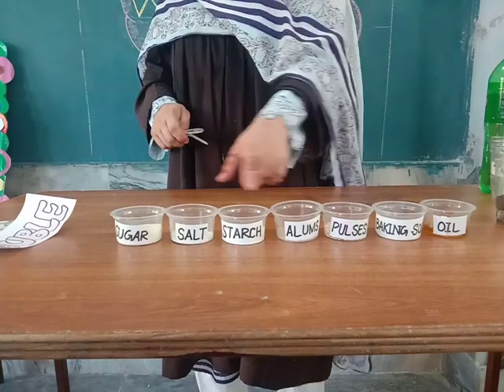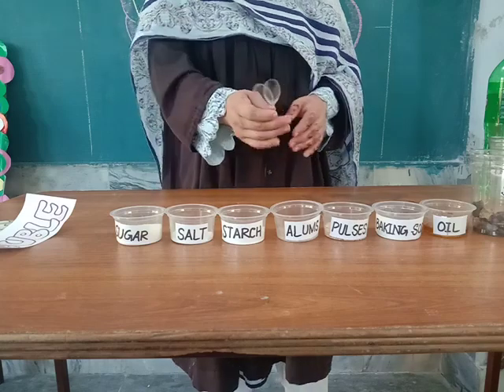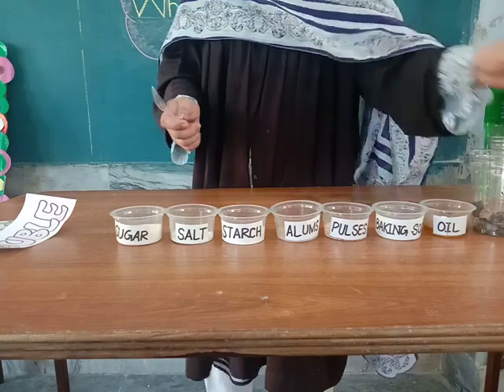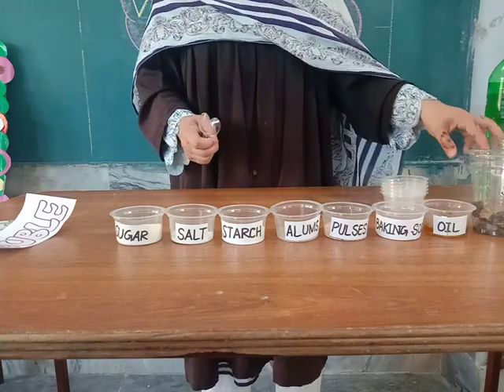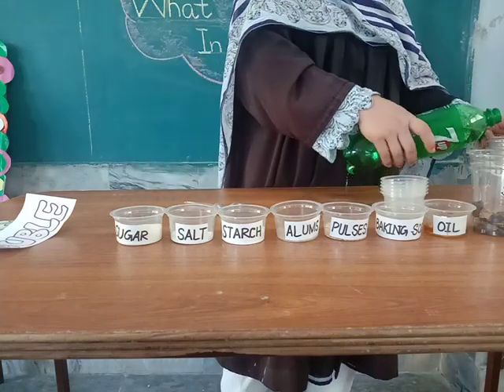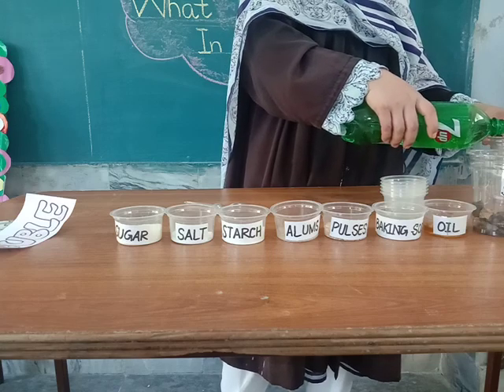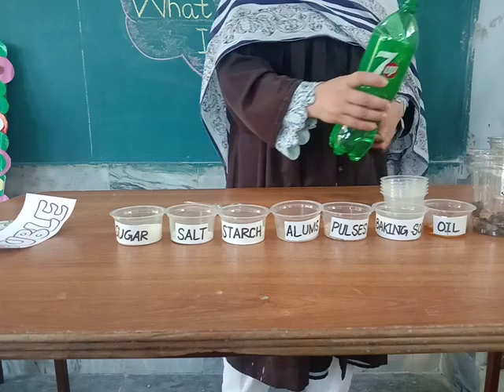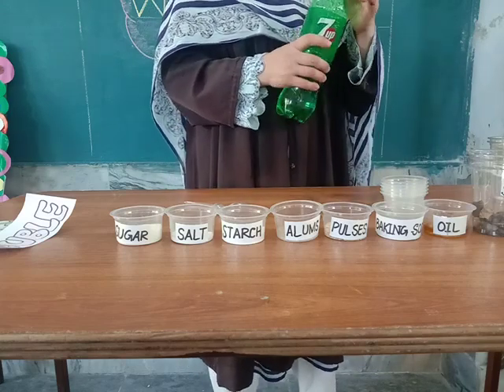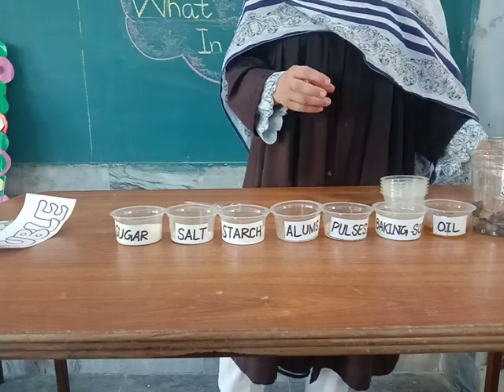We have all these substances that we will dissolve in water. We need stirrers to stir, and we have some containers to test each substance. We will process the results one by one and see which substances are soluble in water and which are not.